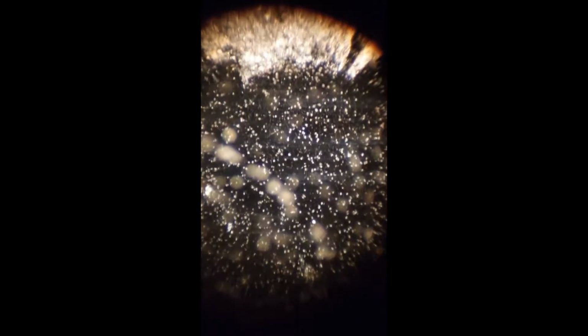There's quite a large number of these. I don't know what each of these species is called, but in general they're called ciliates because they have little structures called cilia, like little hairs that they wiggle and it pushes them through the water. They're basically swimming. In every little bit of pond water you have a very large number of creatures.